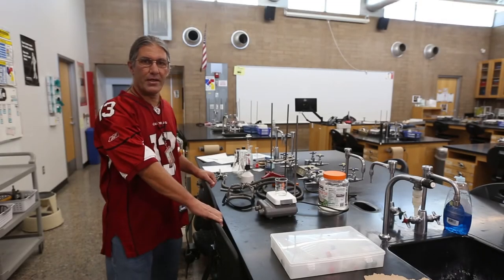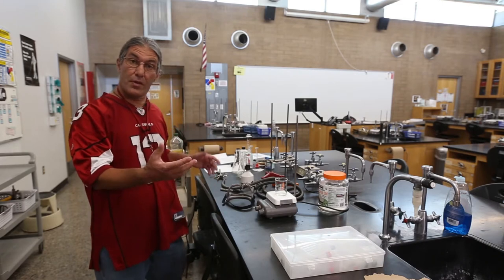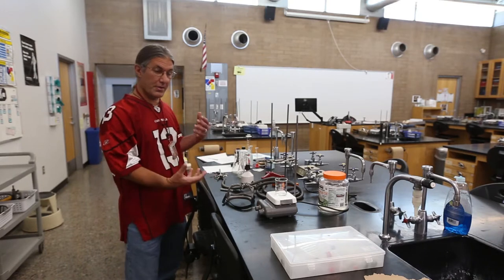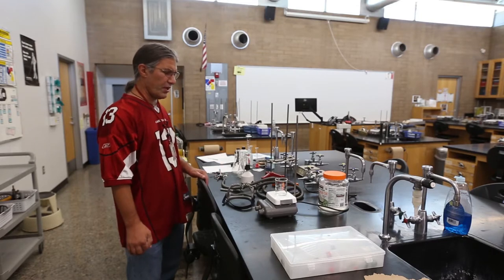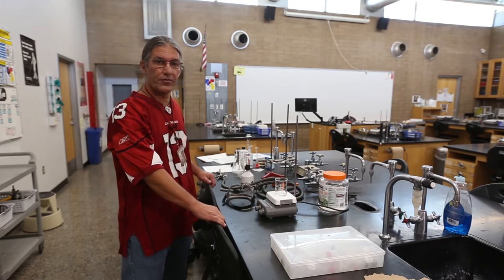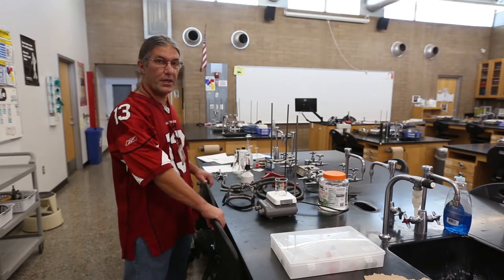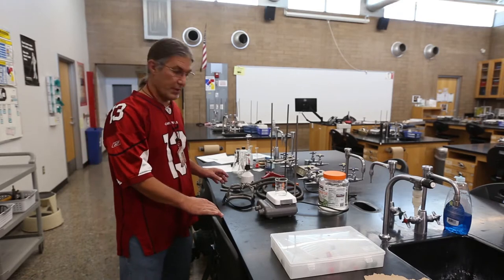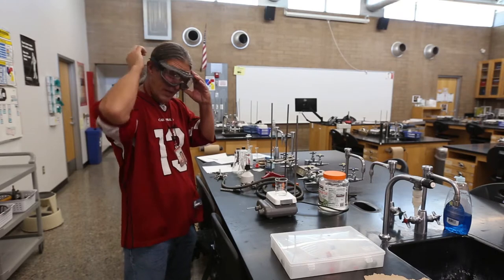Hi, my name is Dr. Bob Blake of Glendale Community College and we're here for the Chem230 lab to do some experiments that unfortunately we won't be able to do in a live setting. I think it's the most fun to actually come and participate rather than watching a video, but the video is a good starting place. The experiment we're going to do today is one I've always been excited about but have never done myself — we're going to make some soap. I've put on my goggles because we're going to heat a solution and it's going to get pasty, so it might splatter.